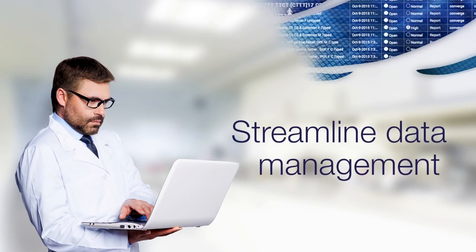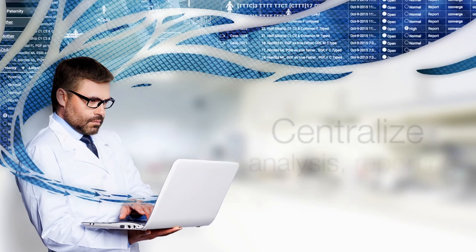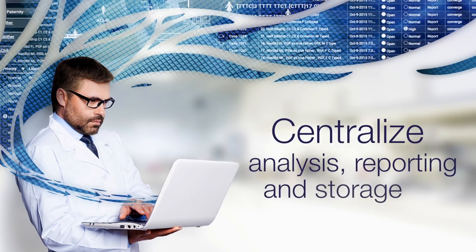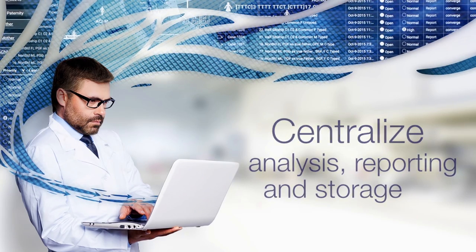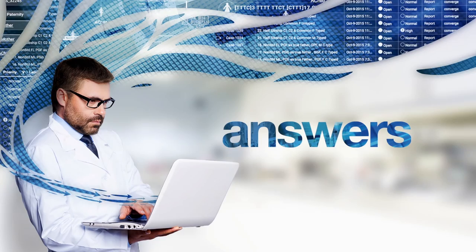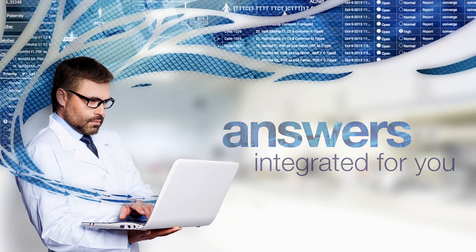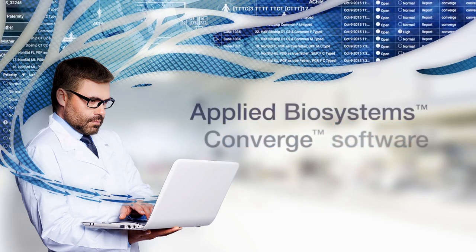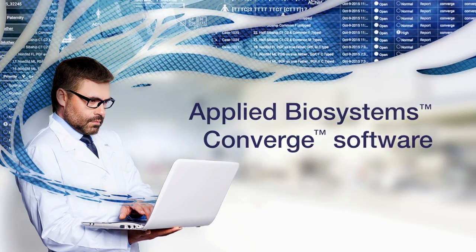Streamline data management with a powerful, centralized solution for analysis, reporting, and storage. Get Answers integrated for you — only from Applied Biosystems Converge Software.